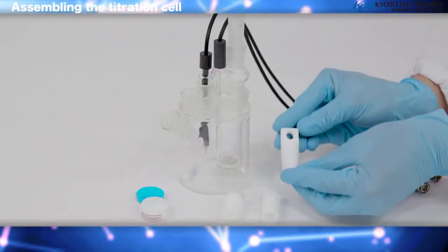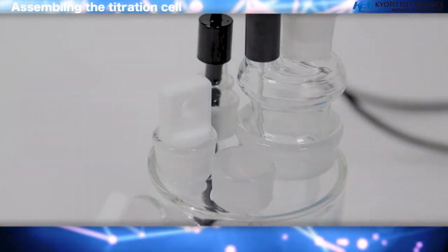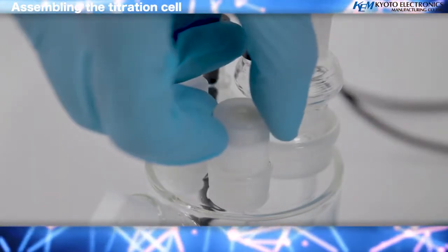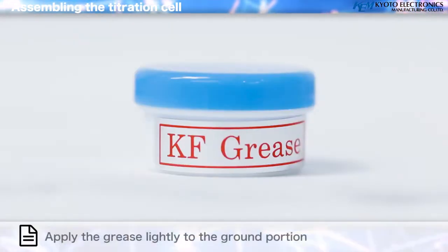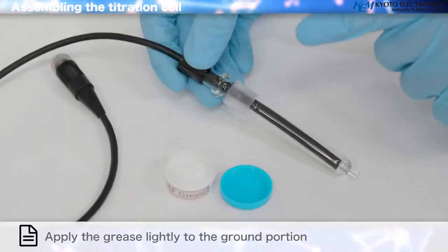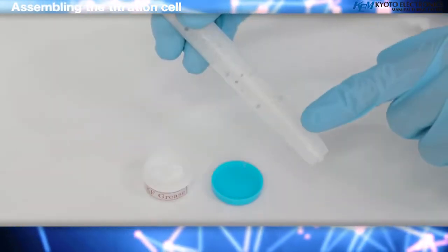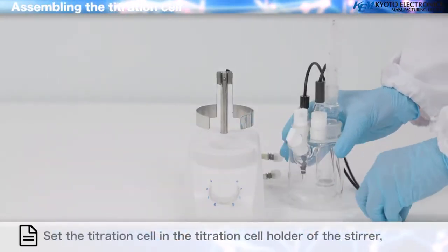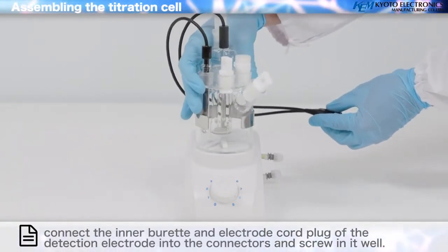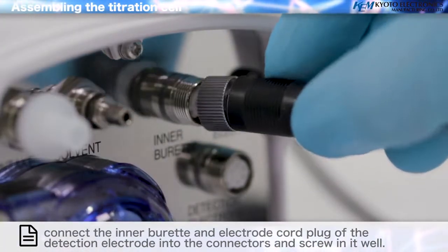Port plug. Port plug and the syringe inlet. Apply the grease lightly to the ground portion. Set the titration cell in the titration cell holder of the stirrer. Connect the inner burette and electrode cord plug of the detection electrode into the connectors and screw it in well.